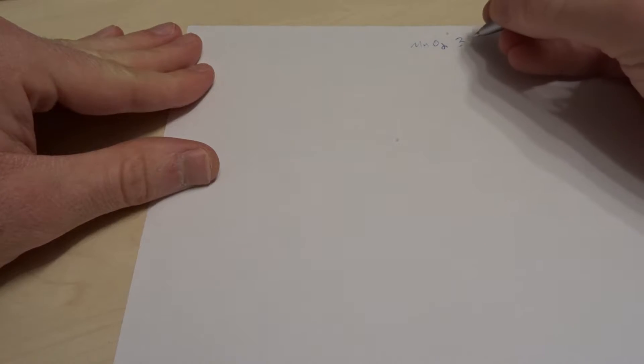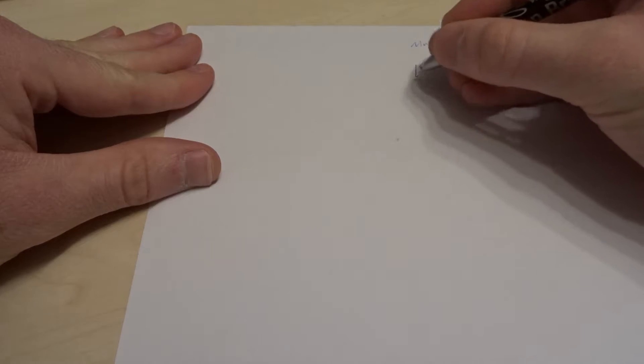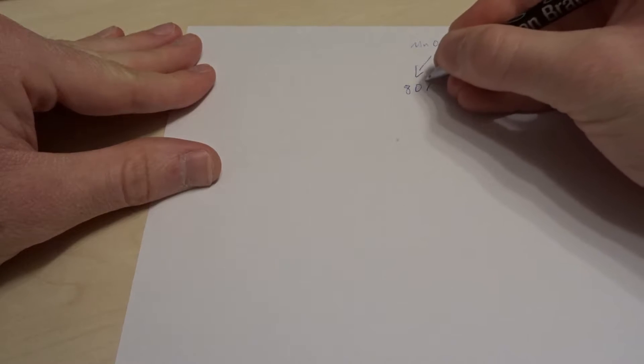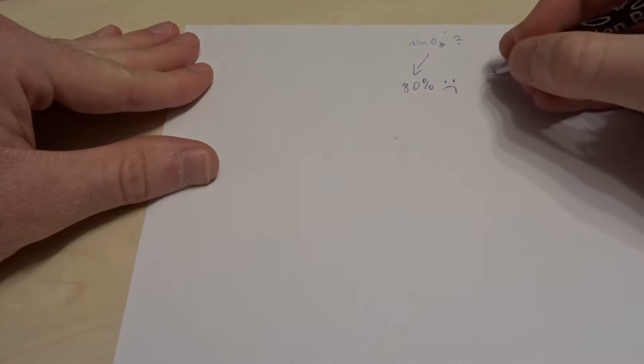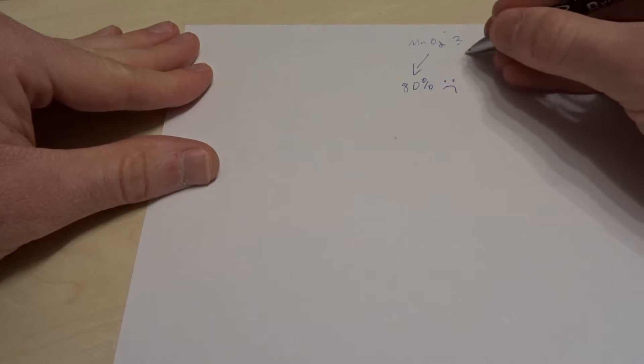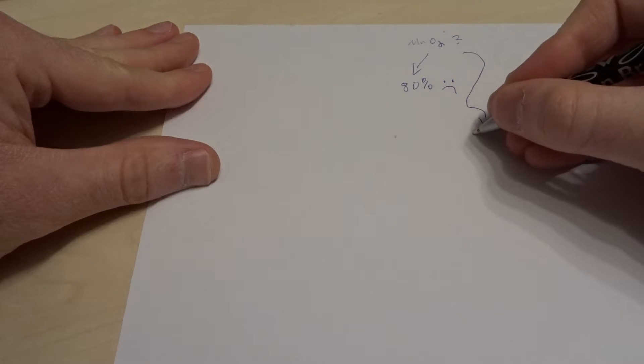So why did I do the synthesis of MnO2 today at all? Well, I've already bought this in store and it was only 80% purity, which is no good for my reactions because I want to use this to make potassium permanganate.